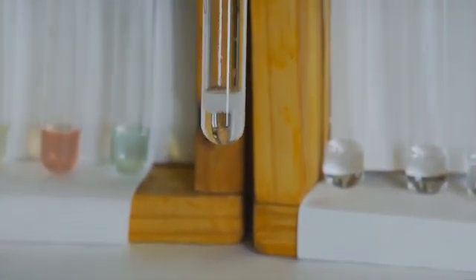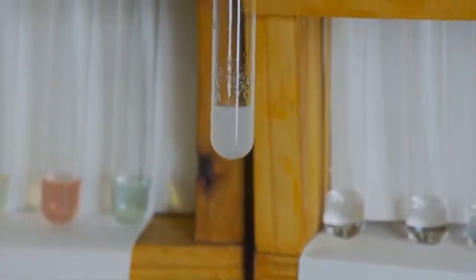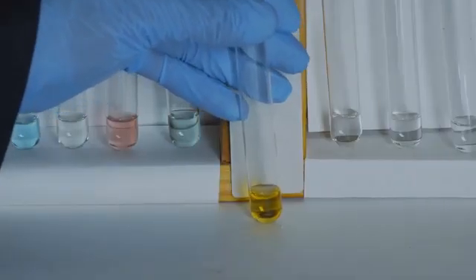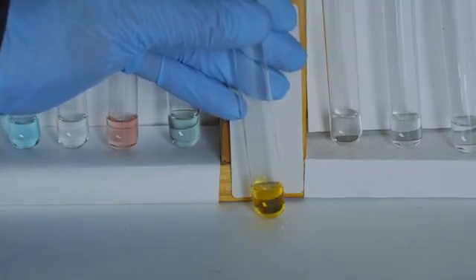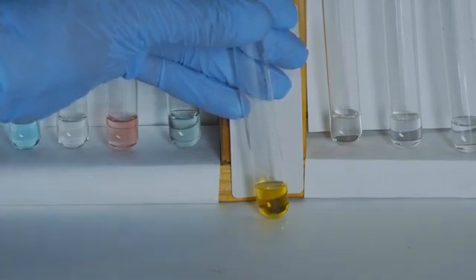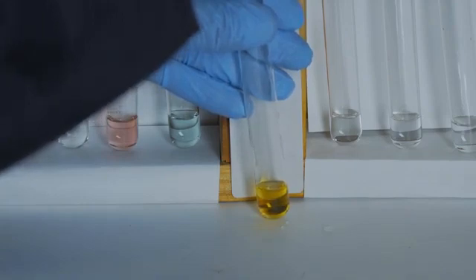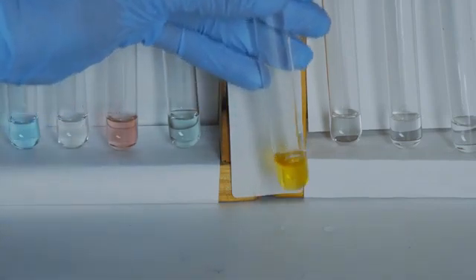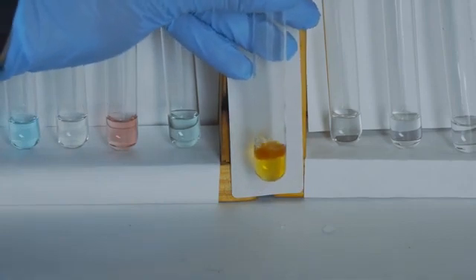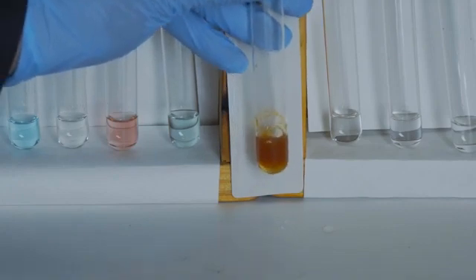To unknown solution B, which is yellow in color, we shall add in 3 drops of ammonium chloride and 5 drops of ammonium hydroxide. This forms a brown precipitate, which gives us an indication of the iron 3+ cation.